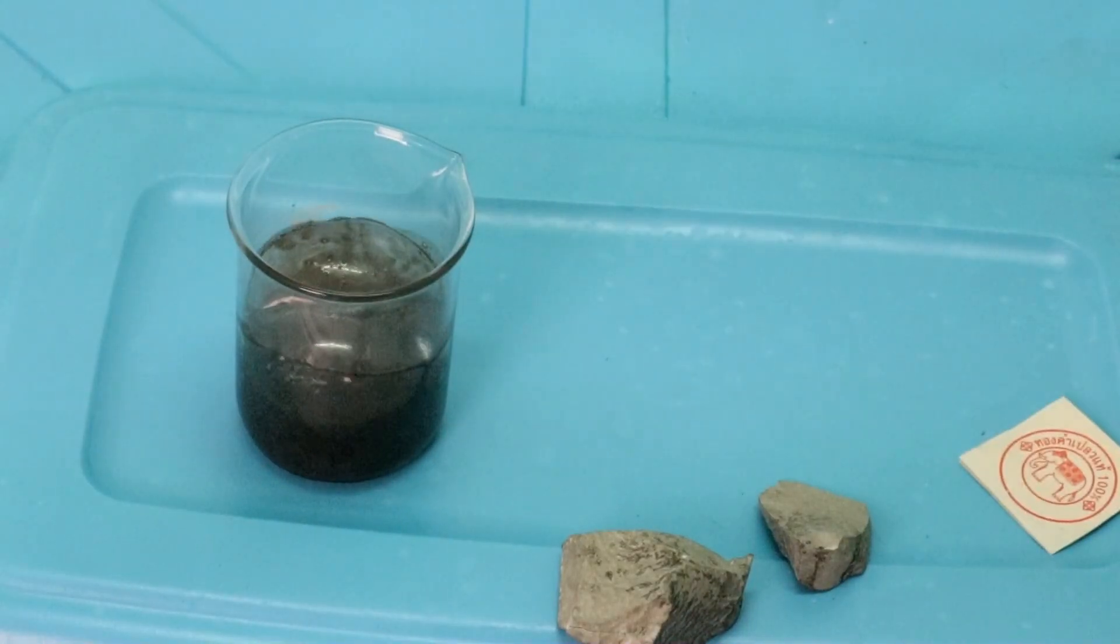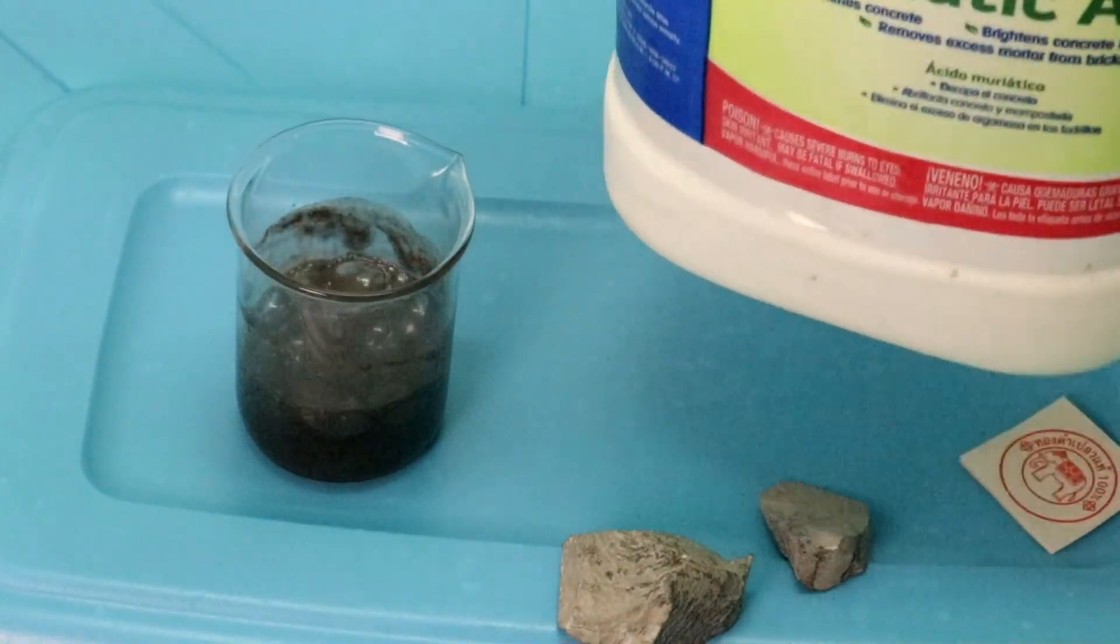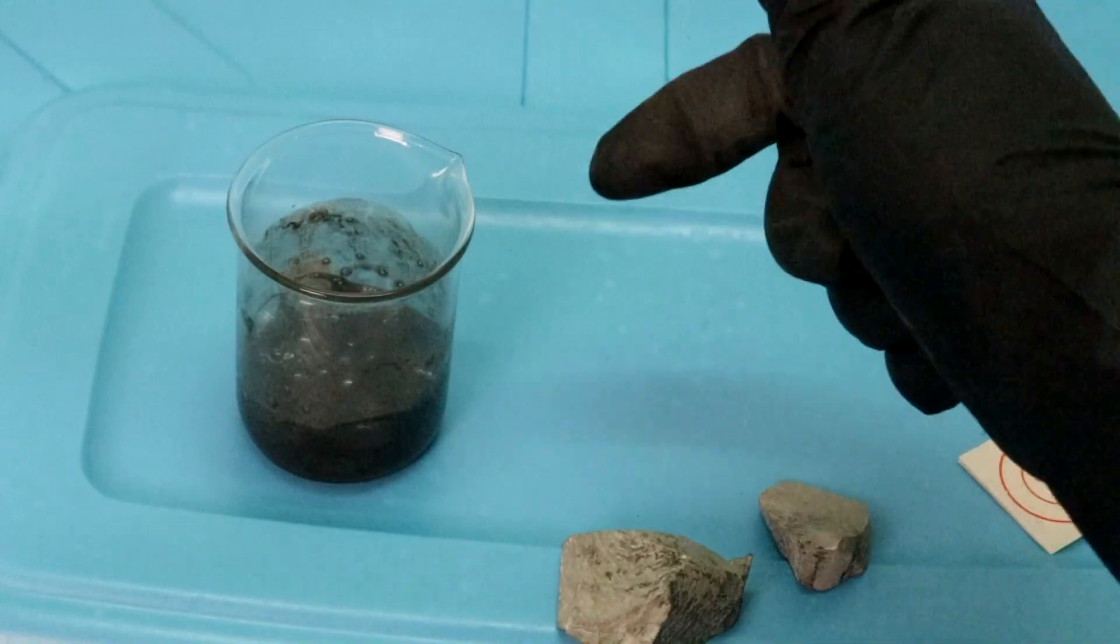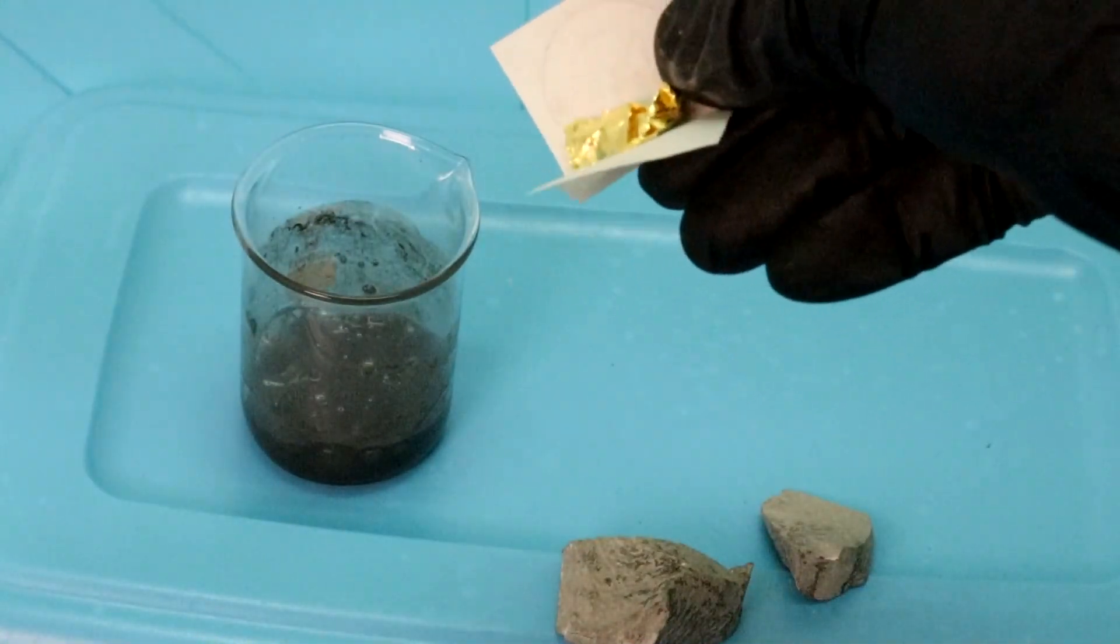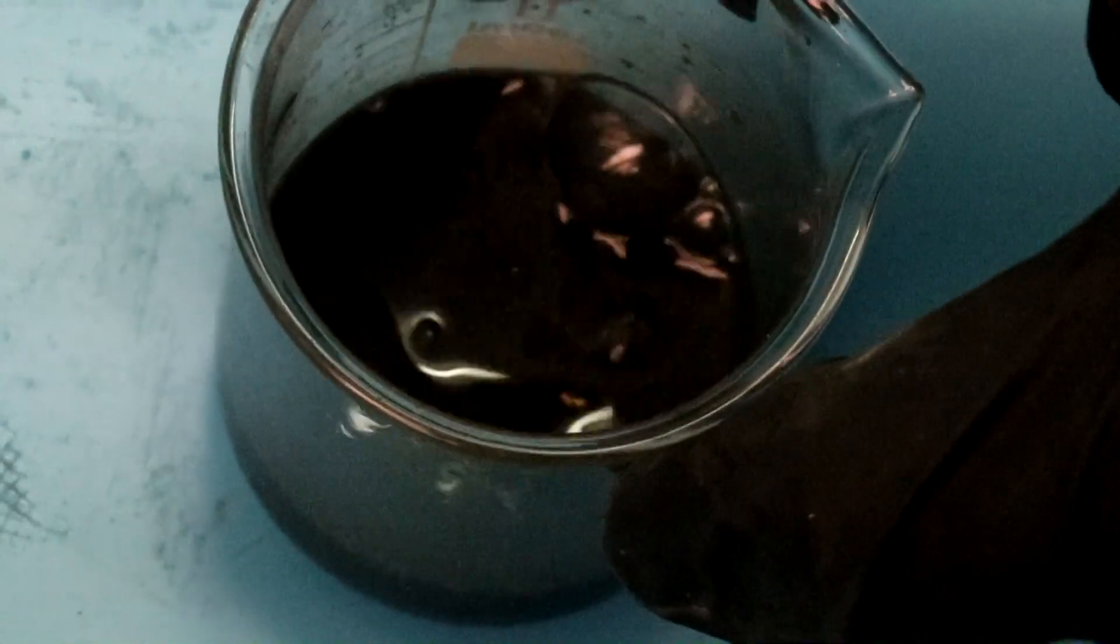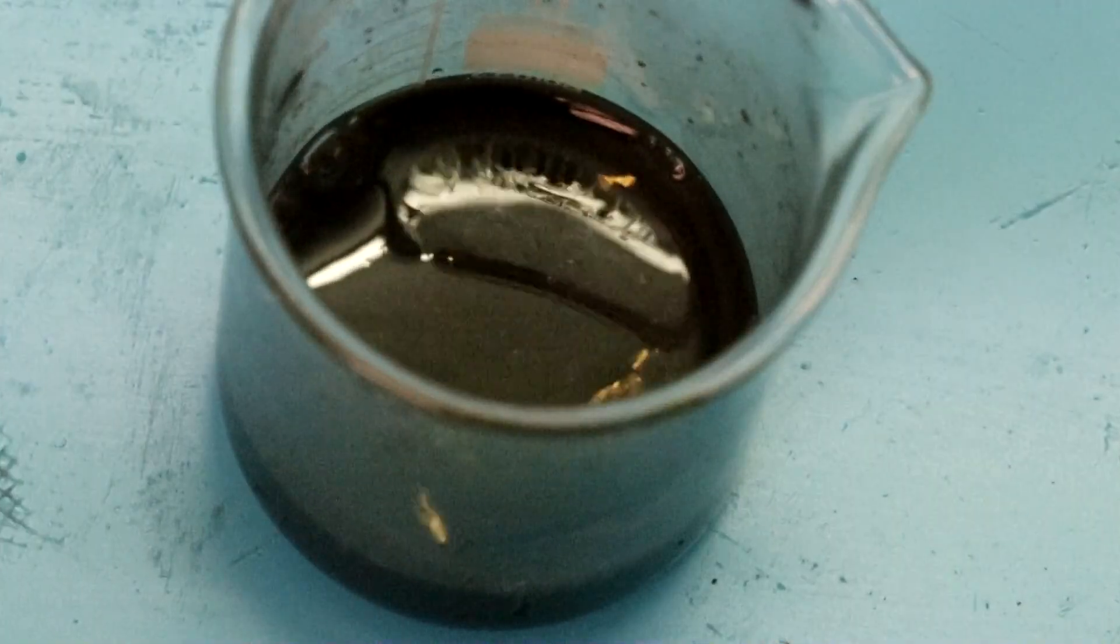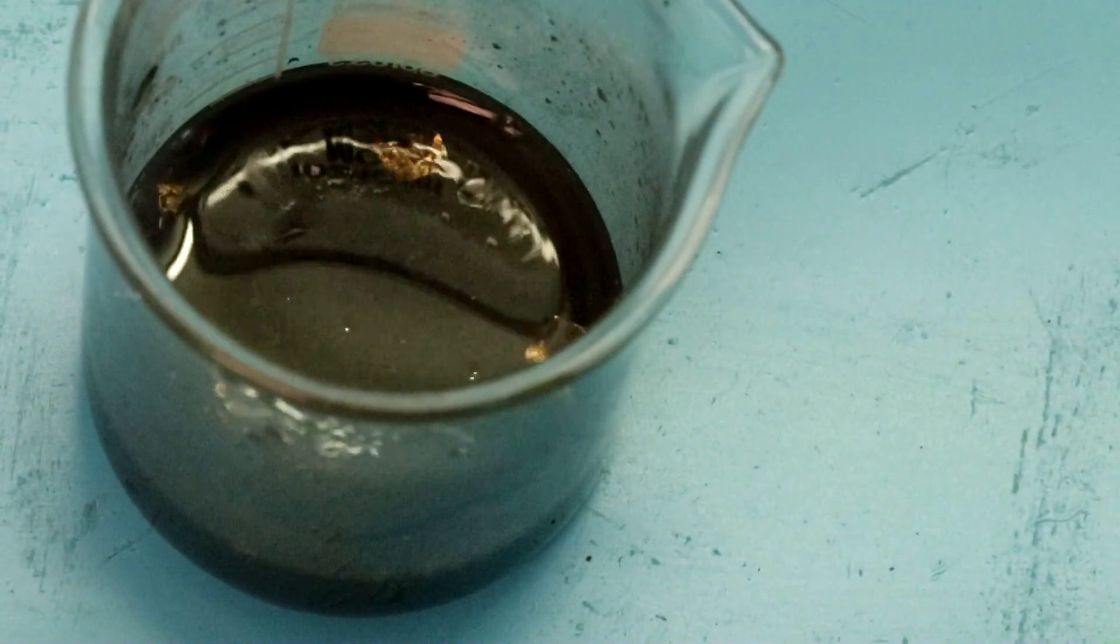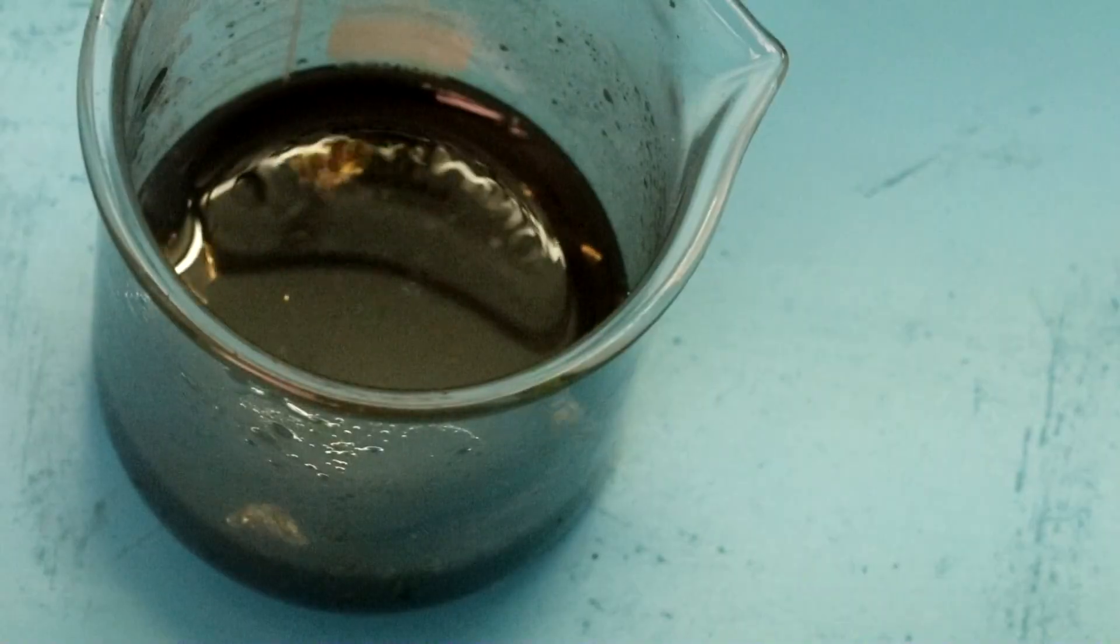And hydrochloric acid on its own, without nitric, will not dissolve gold. So our gold should be left in the rock. But now if I put in some gold leaf to represent the gold, give this a bit of a stir here. Let's just watch these gold flakes over a period of a few minutes. Let's see what happens.